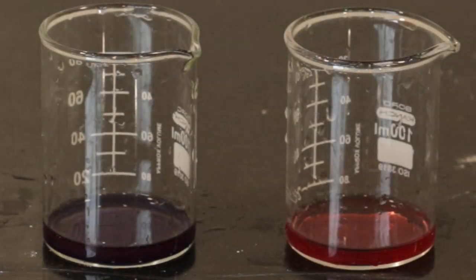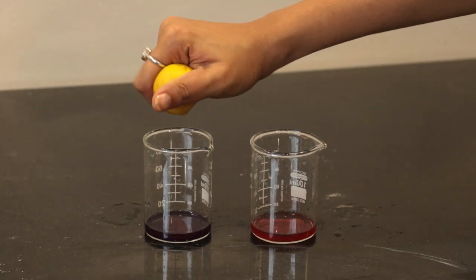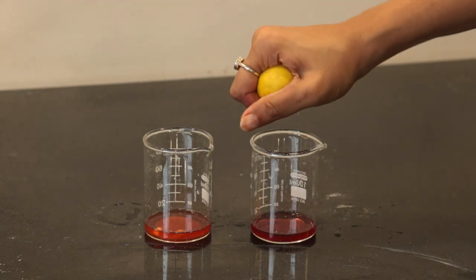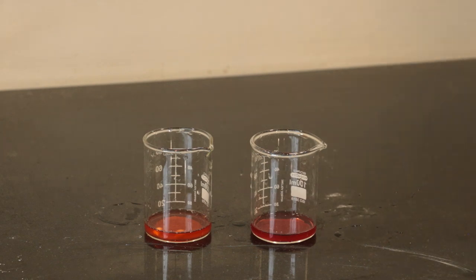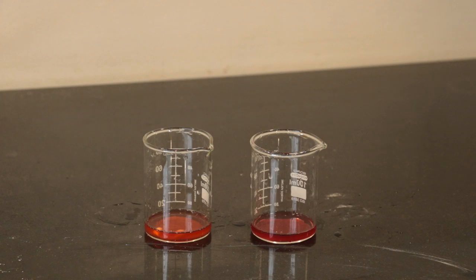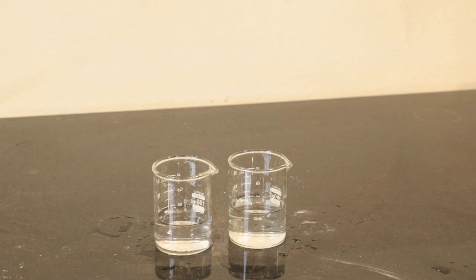To confirm this: lemons have acid in them, and acids turn blue litmus to red. When I add lemon juice to blue litmus, you can see the color is changing to red. But if I add the same lemon juice to red litmus solution, the solution remains red — no color change. So far we've seen litmus color changes for acids and bases. But what about solutions that are neither acidic nor basic, like water? Water is a neutral solution — can you guess what the color change will be?